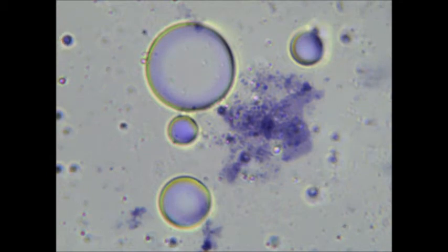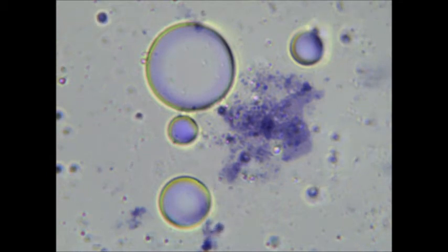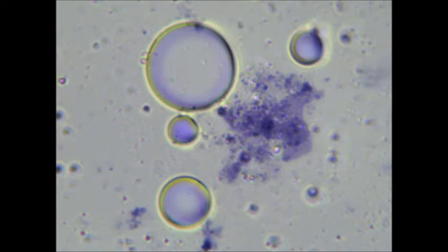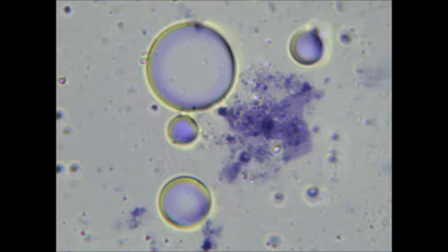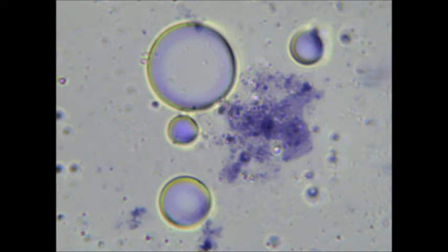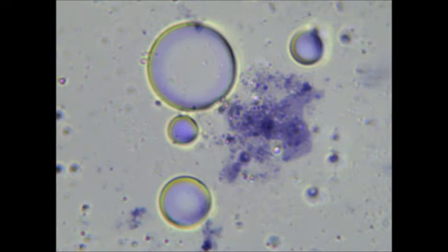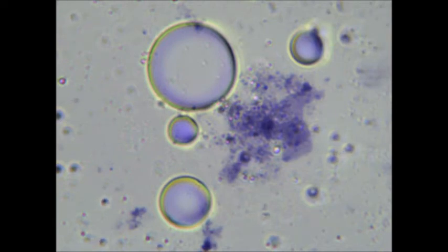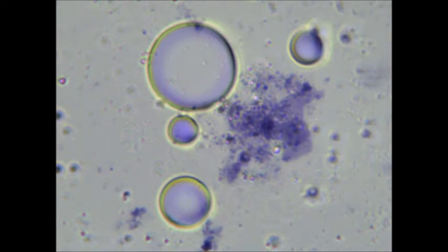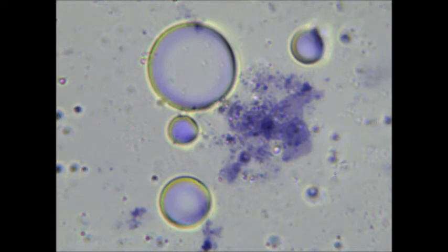Also, I was watching a video on YouTube recently about the origin of life. In the video, scientists were discussing how minerals from rocks were probably necessary for the first life to arise from organic chemicals. My sample does not contain any rock dust, so it may be that I have tried this experiment in vain.